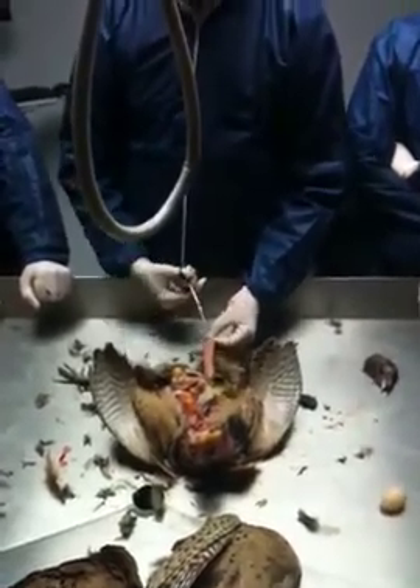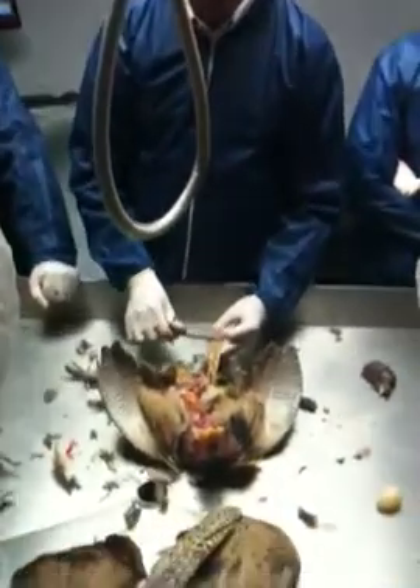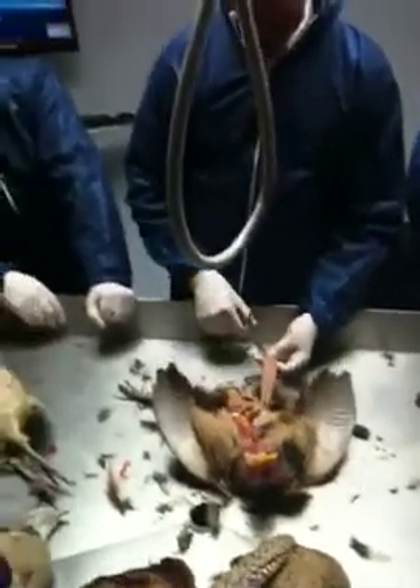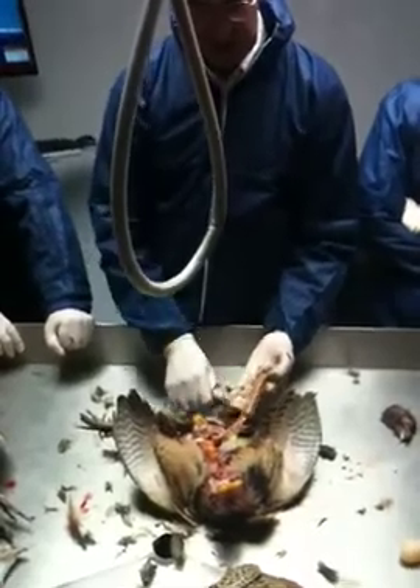What we often do is just open up both loops and have a look, see if there's any hemorrhage. Nice, quite nice and clean they are there.